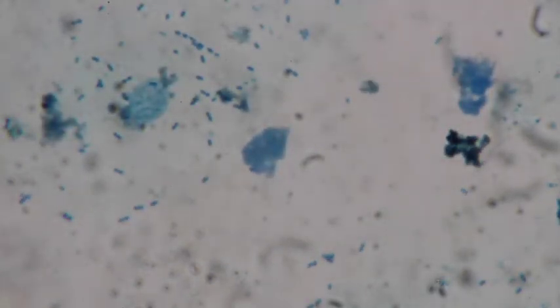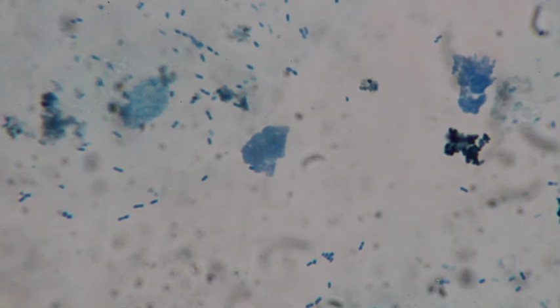And then we can get those bacteria. Bacteria have a variety of different shapes, and you can see a lot of different shapes in here. Most of them look like very small rod shapes. A lot of them are in pairs, so you can see how they're in pairs of 2. We have a chain in the upper middle, kind of a string of 1, 2, 3, 4, 5, 6, 7 of them there. We have a couple that are a little rounder, which are called cocci, rather than rods. Most of these are small rods, but there are a few that are a little bit coccus shaped. So a variety of different ones.